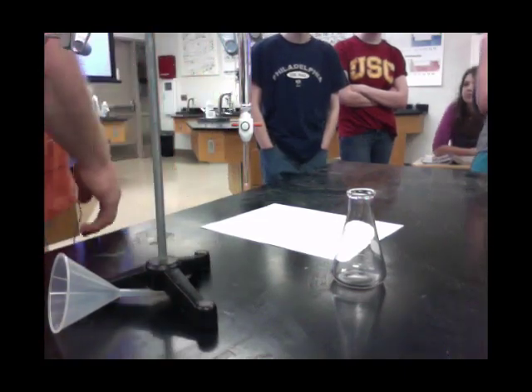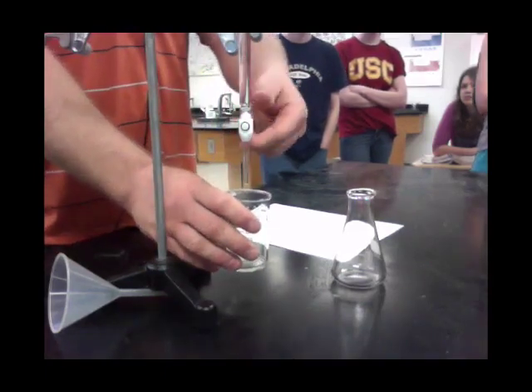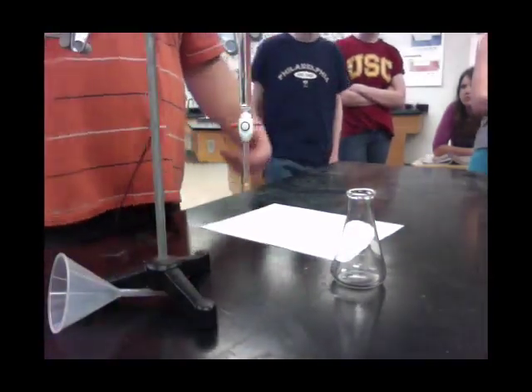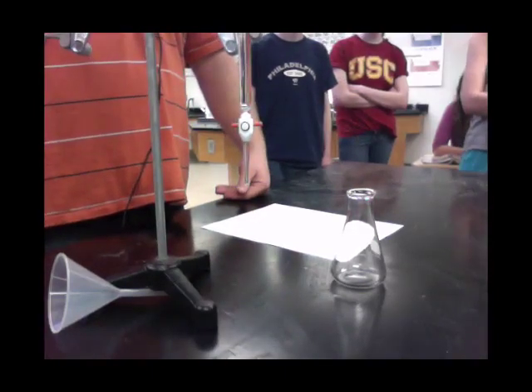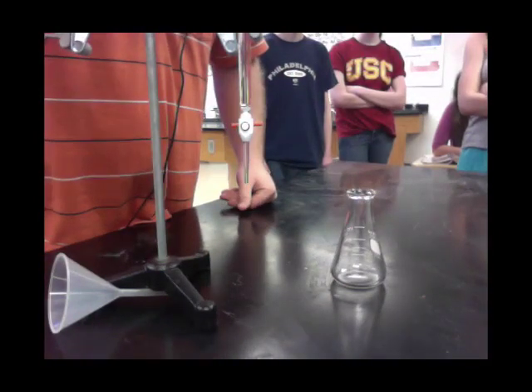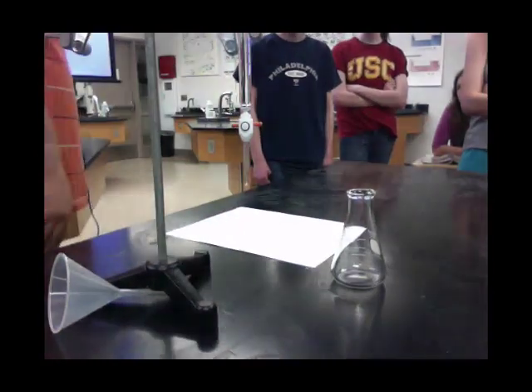The first step is to make sure the burette is full of volume. Take a waste container and run a little bit through there — this is all waste that can get dumped. As we do our titration, you want to read the volume off of your burette as precisely as you can, probably using some sort of background so you get a good reading. I get 3.85, so 3.85 is my value.